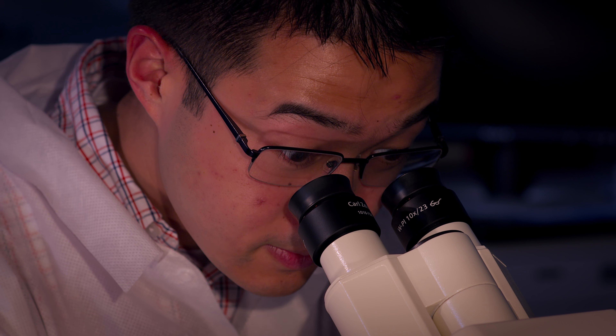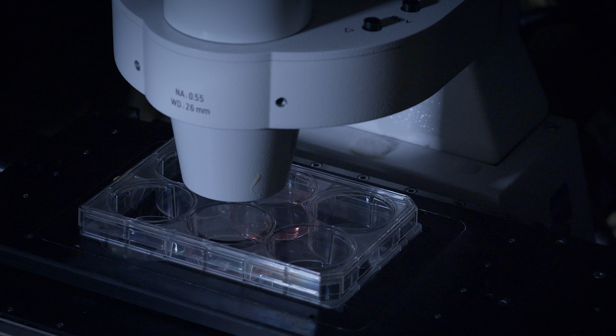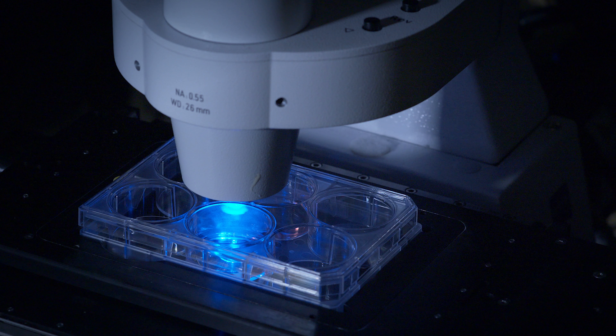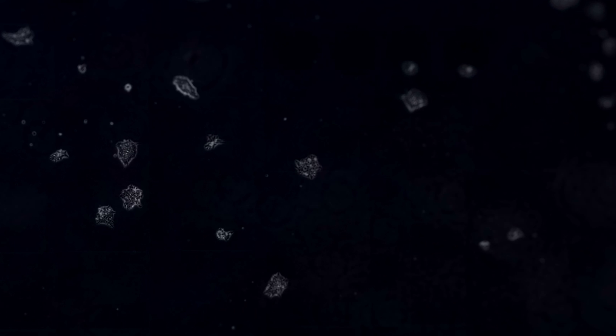The WIPP system really allows any investigator with an automated imaging tool to run continuously or collect large numbers of images from different samples, and the ability to manage and work with that data is no longer a bottleneck with the WIPP system.